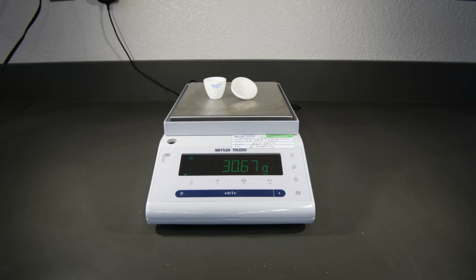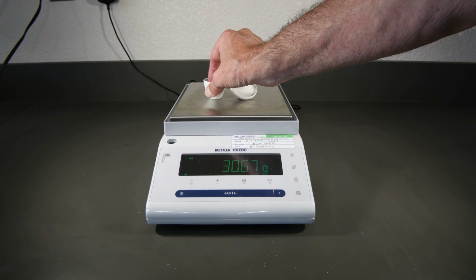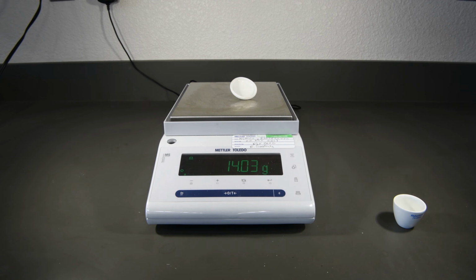Now it doesn't say to do this in the lab, but I sometimes find it useful to weigh the crucible cover by itself, because sometimes in the course of the lab, if you drop it and break it, then you no longer have that mass. So if we weigh it separately, if that does happen, we can simply add that mass to it at the end. So let's get the mass of the cover itself and just write that down in the lab book somewhere in case we need it.